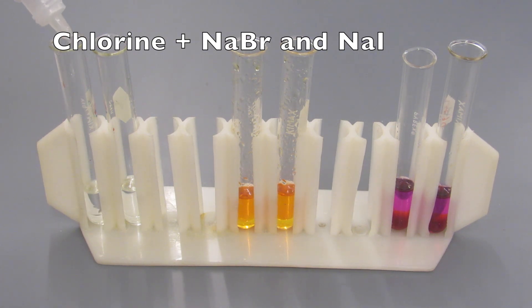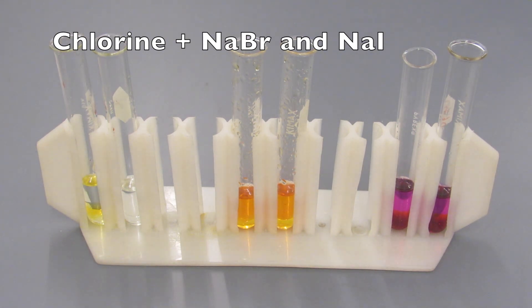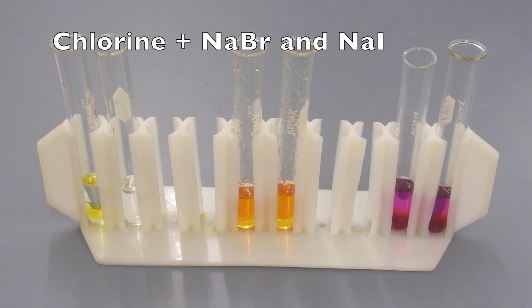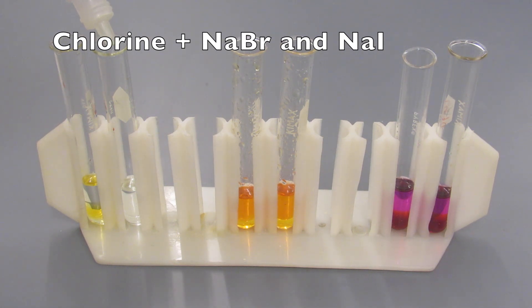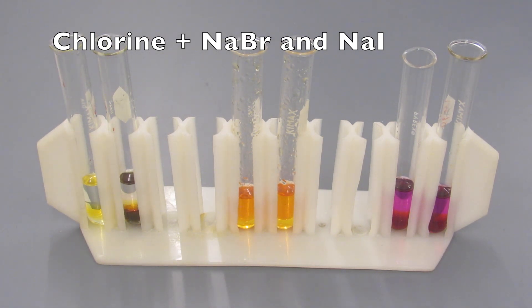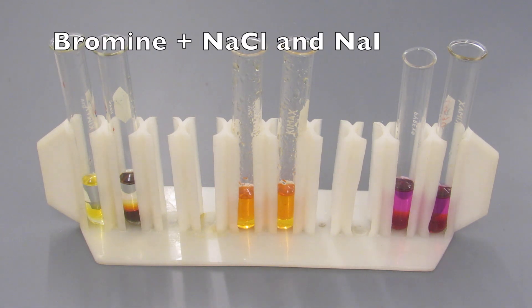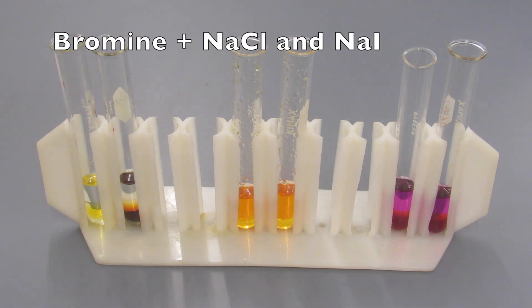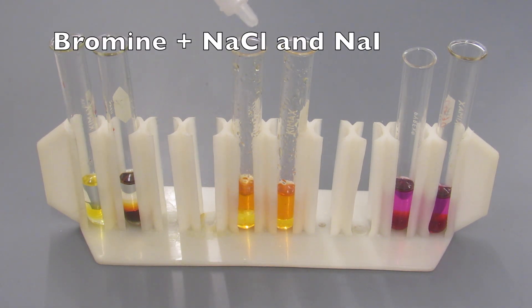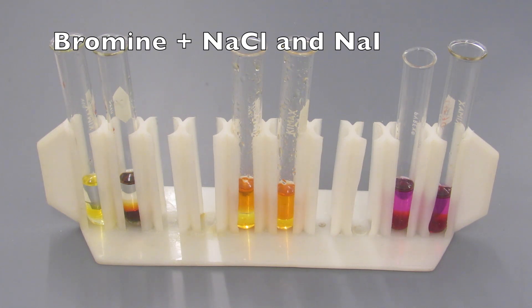Now that each solution is mixed up, we're going to start by adding sodium bromide and sodium iodide to the flask that contains the chlorine. You can notice that you see a color change right away. We're going to add the sodium chloride and sodium iodide to the bromine solution.